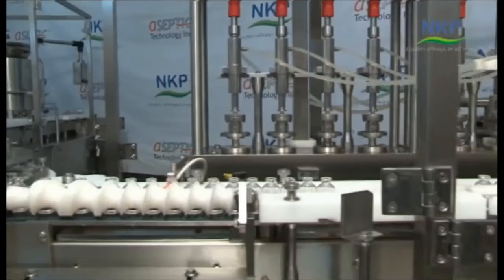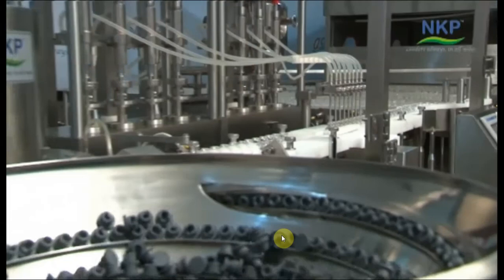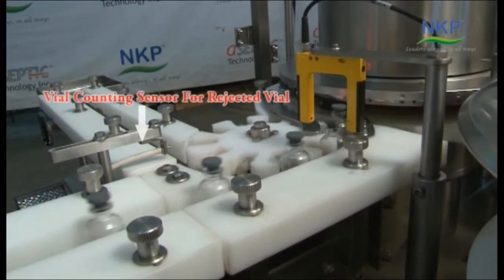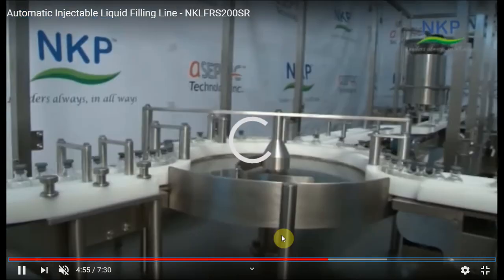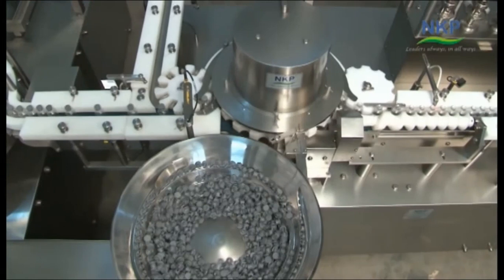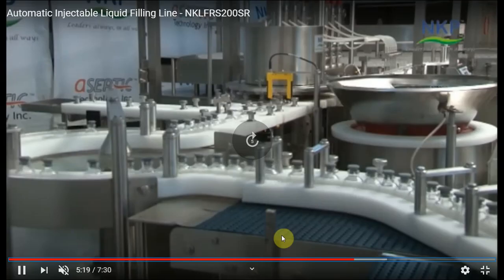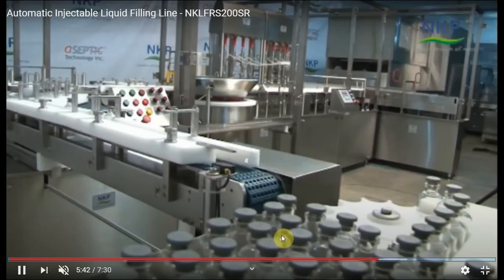And after that filling, you can see the caps. Now caps says rejection track for no rubber stopper on vial, and vial counting sensor for rejected vial. Tray collection of half stoppered vial. You can see the stopper over the vial in this area. Sliding conveyor for main movement before tray collection.